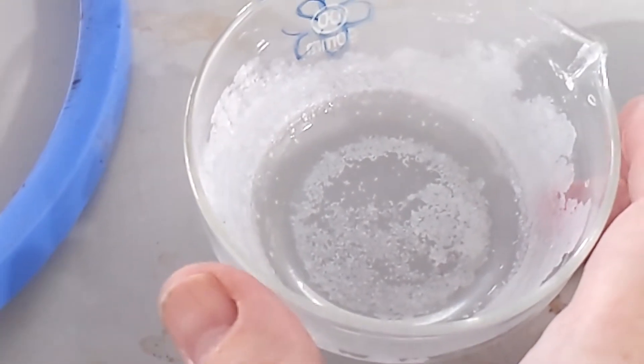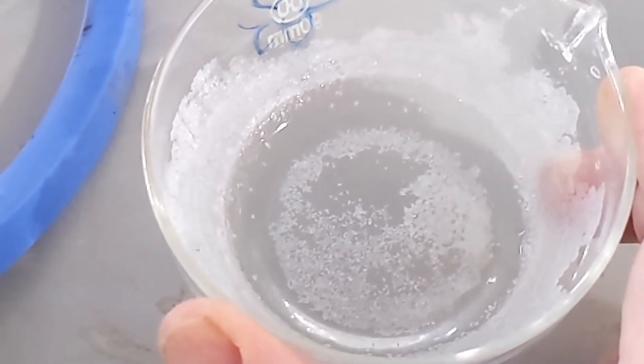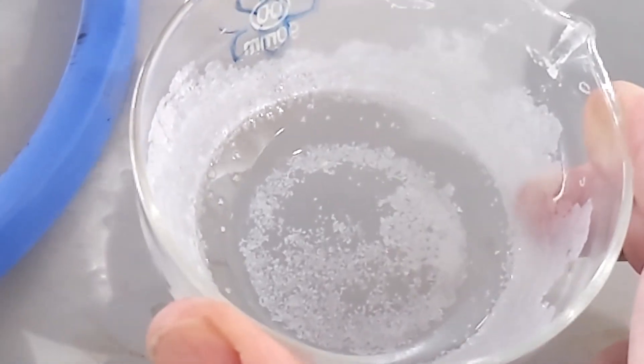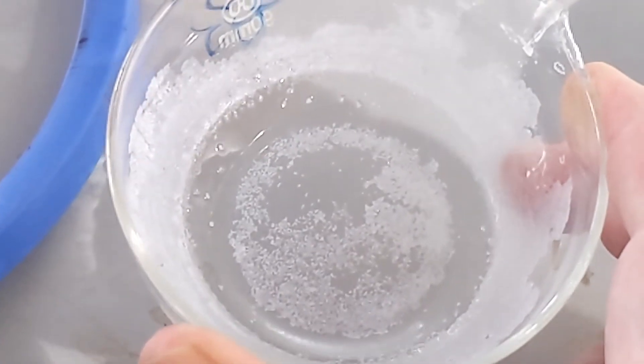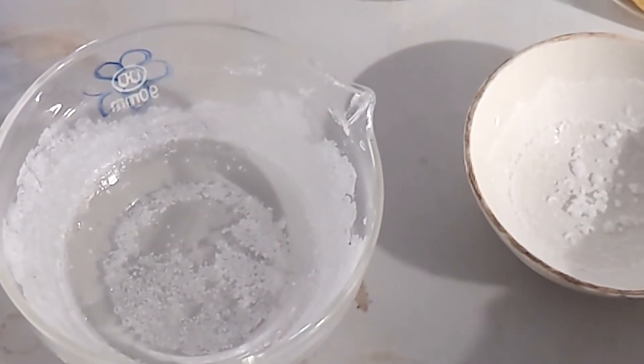In the glass evaporating dish this also crystallized from a concentrated solution but rather quicker. Look at the size of the crystals there. Compare the size of the crystals.